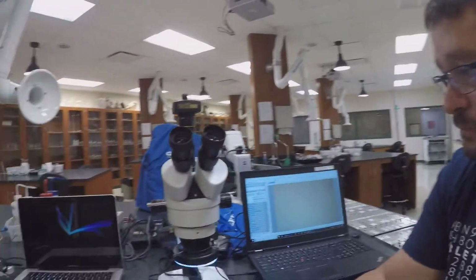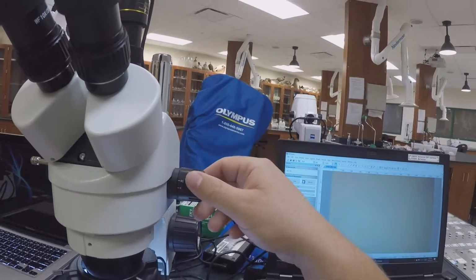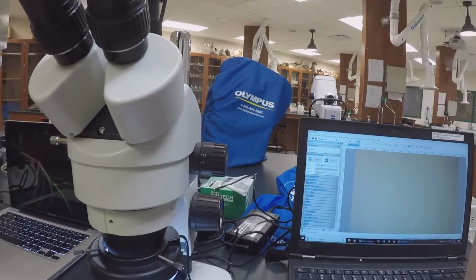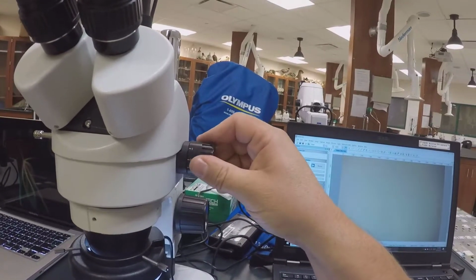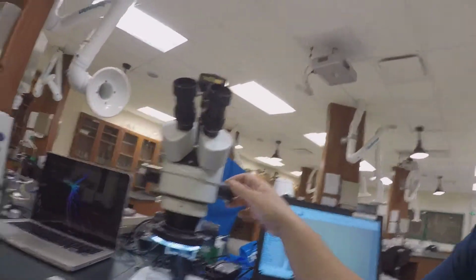The other thing about dissecting microscopes is there's only a single lens. The lens is inside, and to adjust it, it's just a series of mirrors, but there's an adjustment knob here with some magnification values on it. This 4 here is basically telling you that that's 4 times your eyesight. And you can turn it to 1 times your eyesight, 1.5, 2, 3, 4, 4.5 times your eyesight.